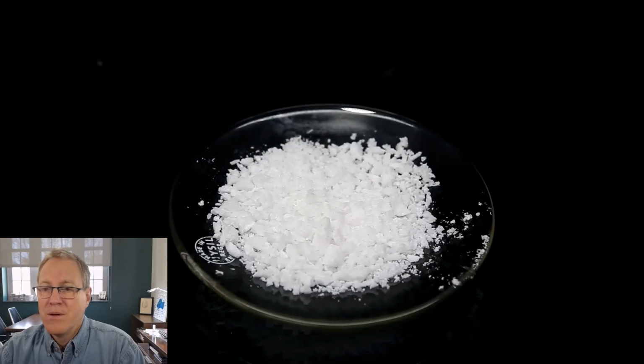The method that I showed in this video might work on other products that contain lidocaine, but I can't guarantee it. I did try it on a few others, and none of them worked, and on top of that, all of the ones that you can easily get from the store will probably have a maximum concentration of 1%.